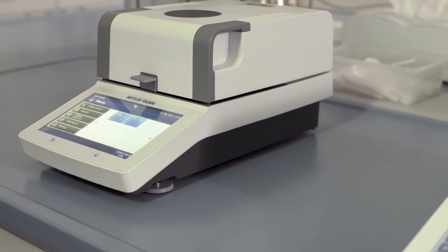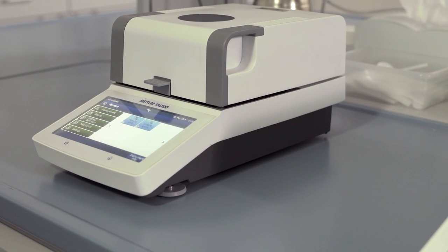Now you know all the functions on how to use the instrument for daily routine measurements.